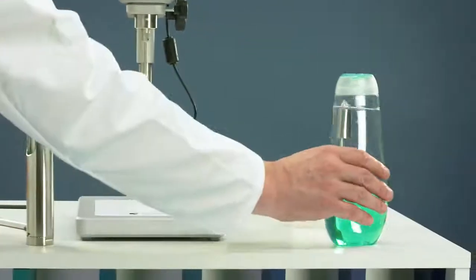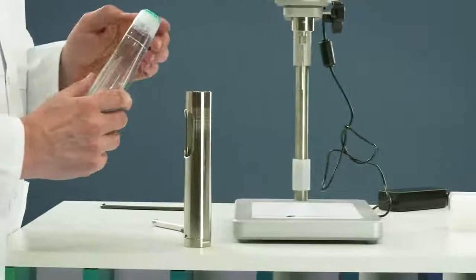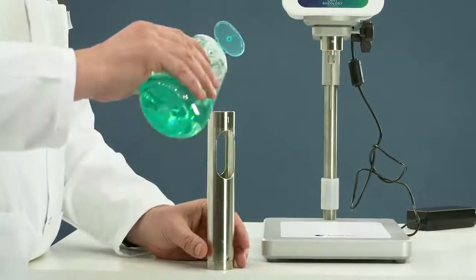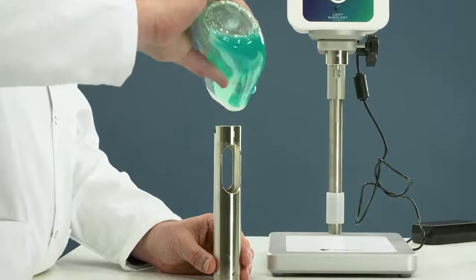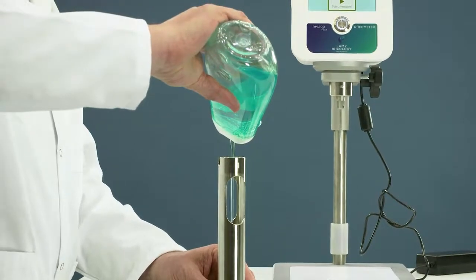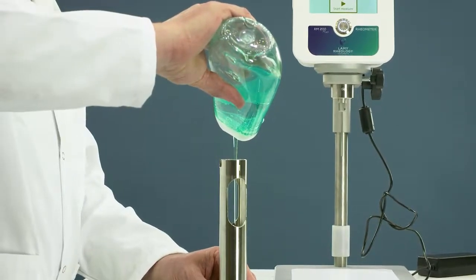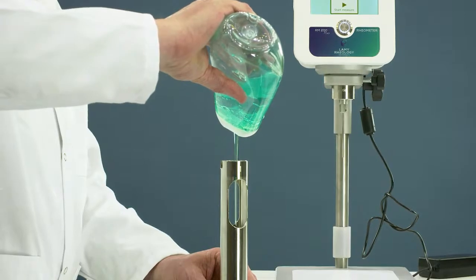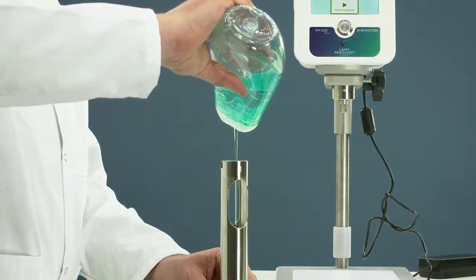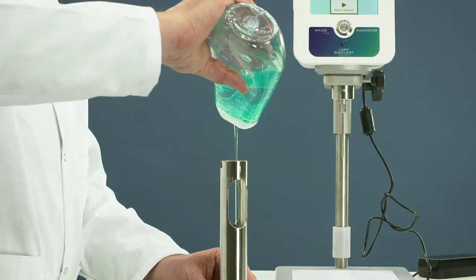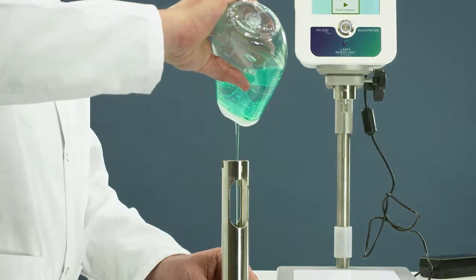Fill the tube with your sample. Respect the liquid level by using the mark inside.